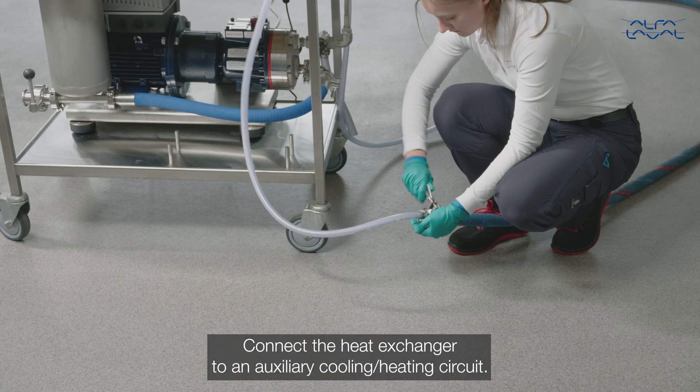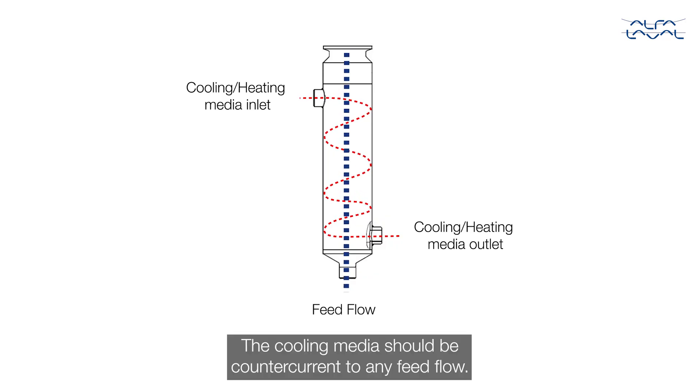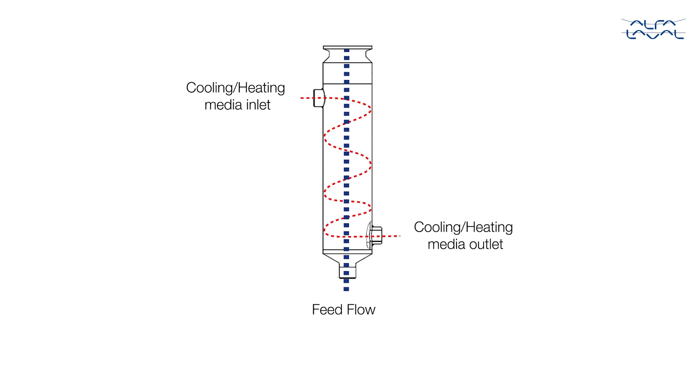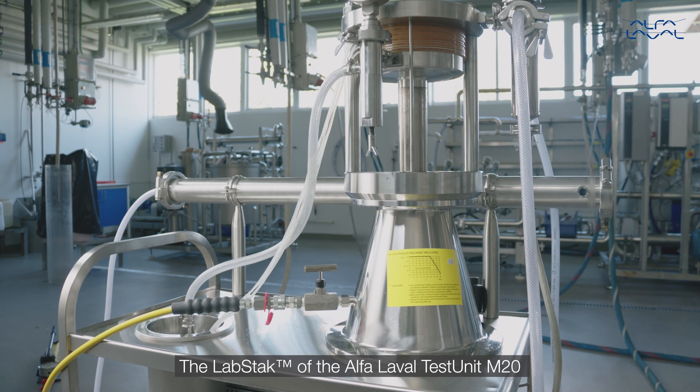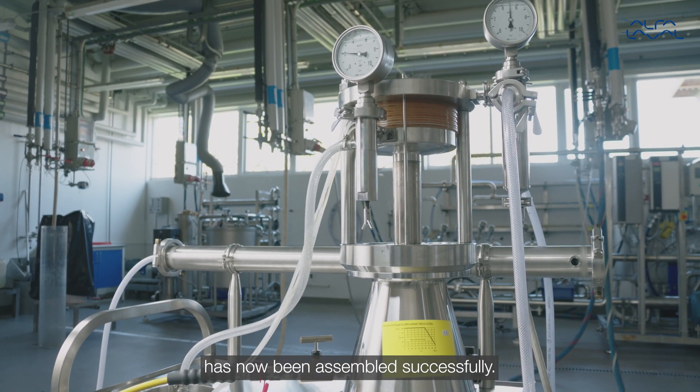Connect the heat exchanger to an auxiliary cooling heating circuit. The cooling media should be counter-current to any feed flow. The lab stack of the Alfa Laval Test Unit M20 has now been assembled successfully.